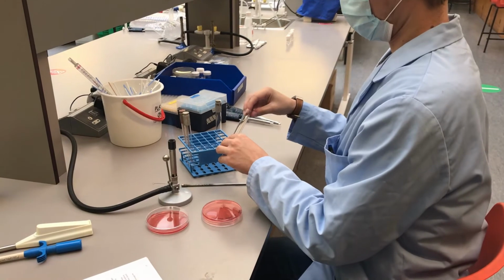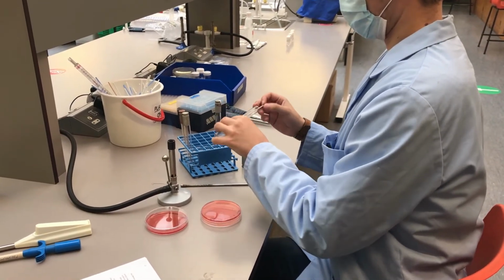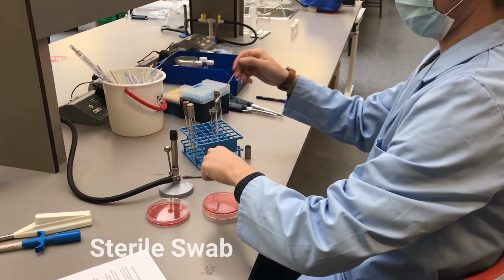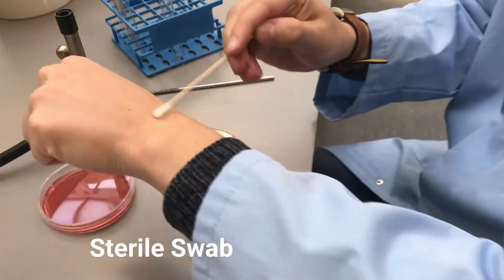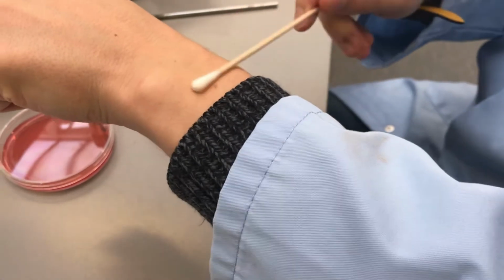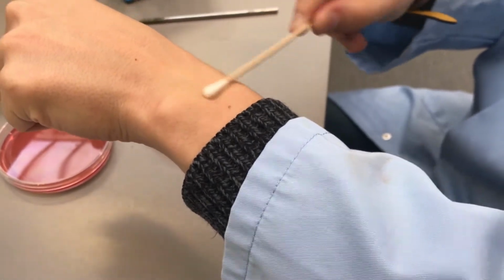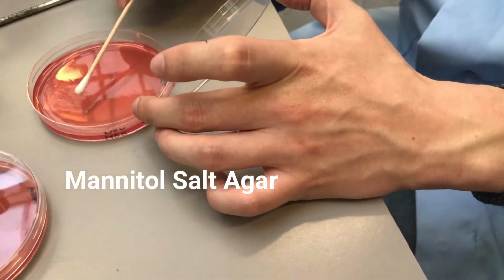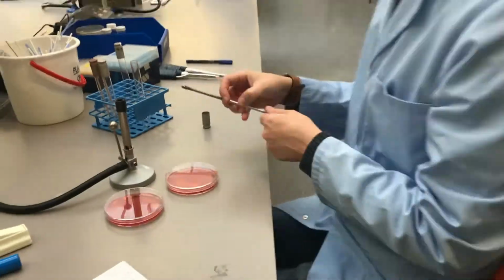Repeat this procedure using a fresh, sterile swab on the skin. These plates will be incubated overnight at 37 degrees Celsius.